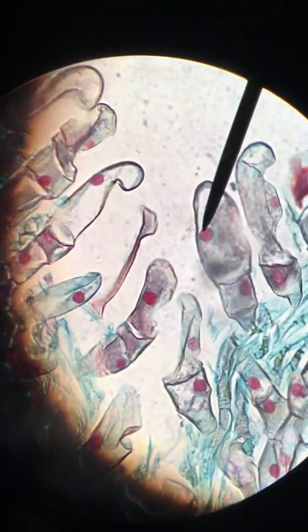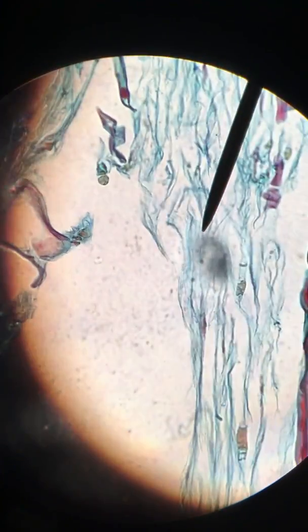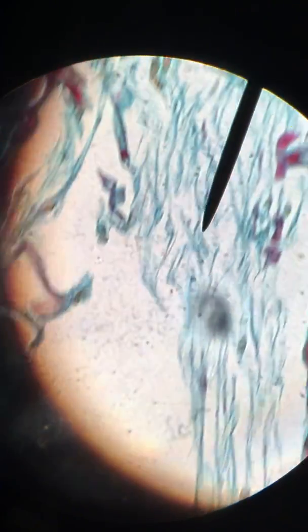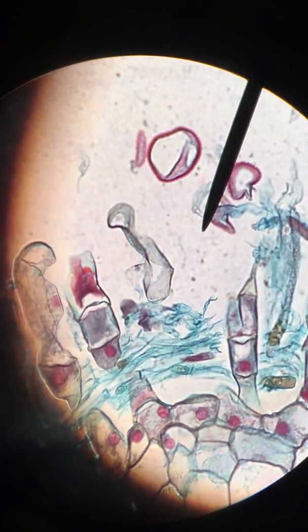They've gathered at the top here. One of them will then produce a tube which will travel down the stigma, style, and ovary. Okay, so that's about all we can see. I will decrease our magnification so that you can see the whole structure one last time.